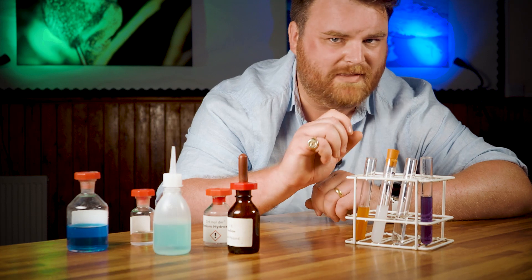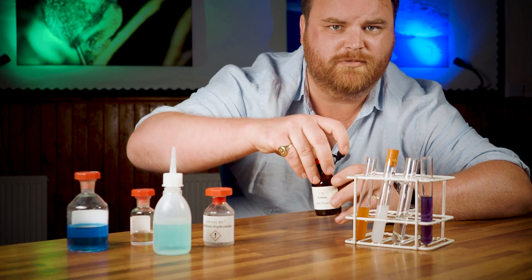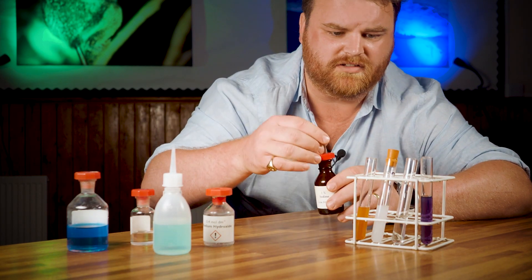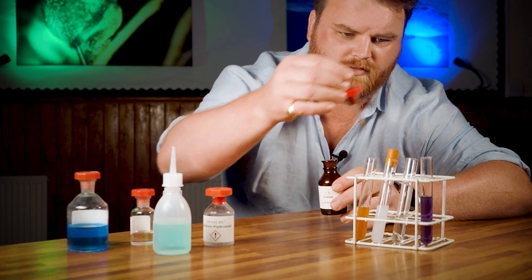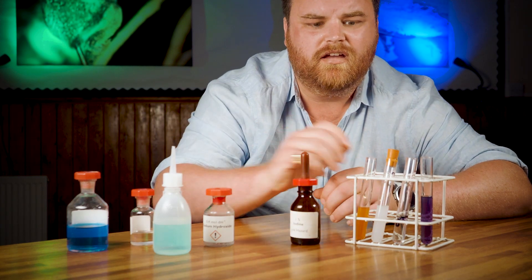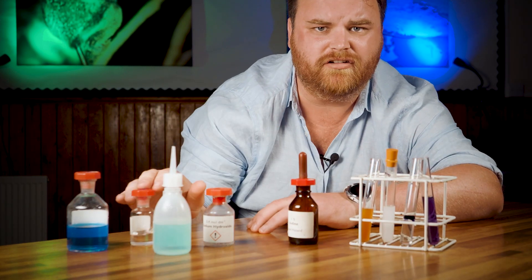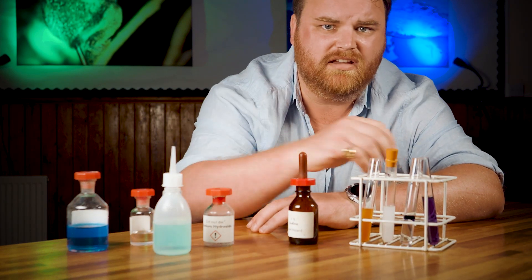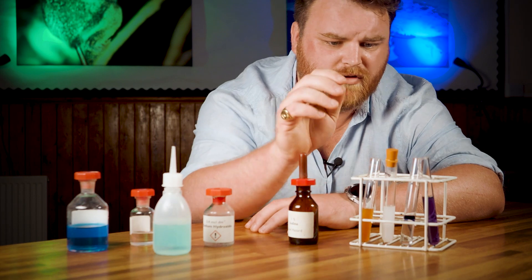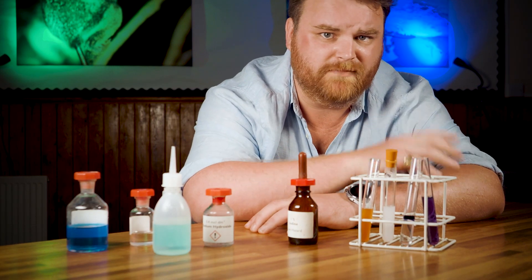Then there's starch — maybe the easiest of the lot. Add iodine; it turns blue-black if there's starch around. Straightforward. And lastly, for lipids, add ethanol and mix. If there's lipid in the sample, you get a white emulsion which looks milky.